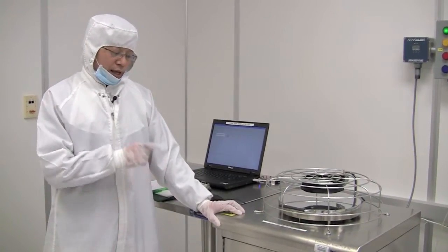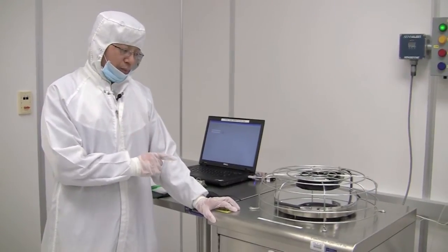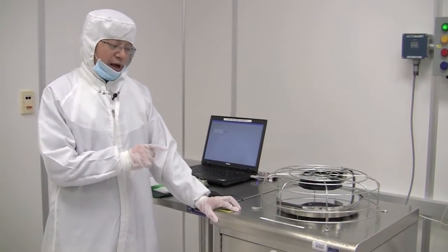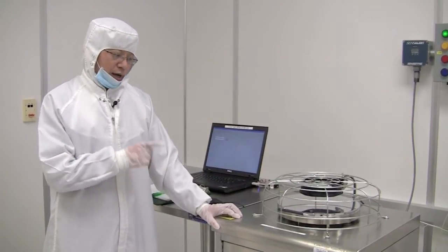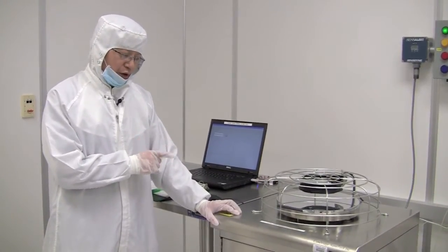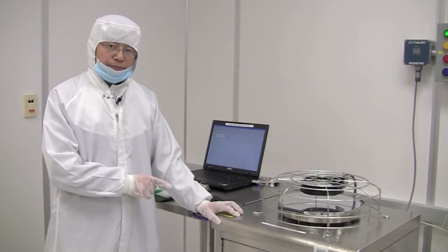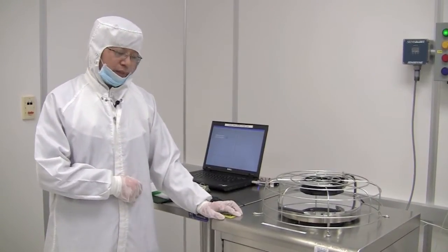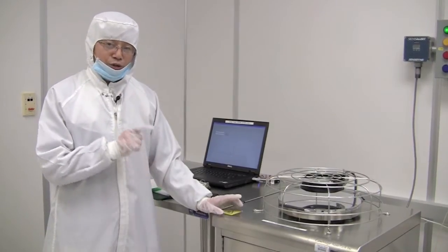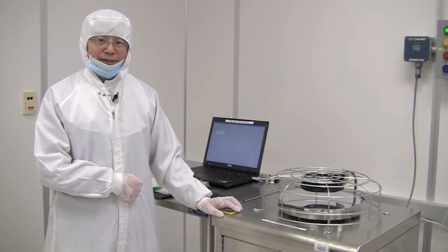This tool can deposit aluminum oxide and hafnium oxide as high-k materials. It can deposit those thin films very uniform and precise in angstroms. It is fast and user-friendly. Now let's begin.